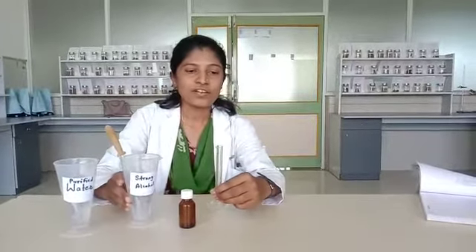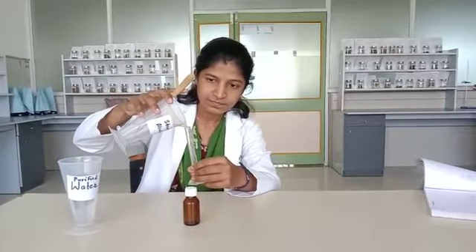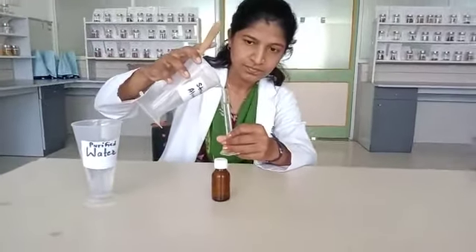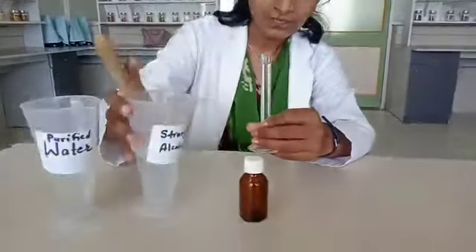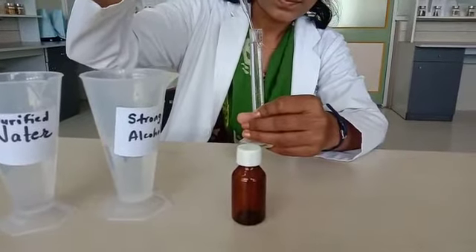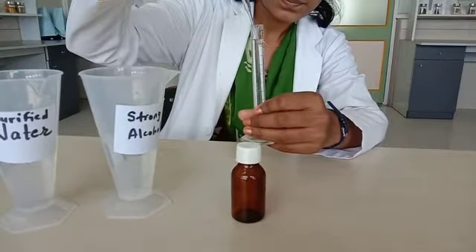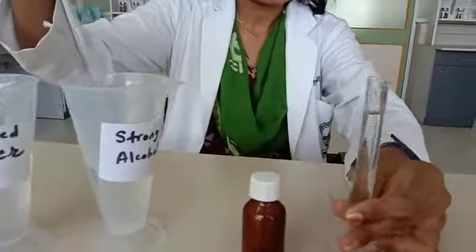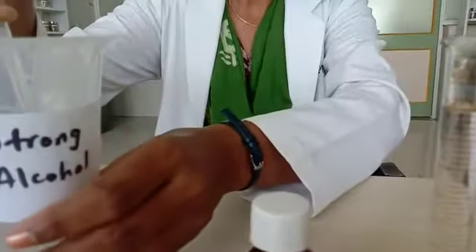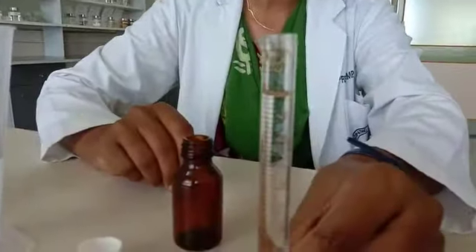First we have to take 10 parts of strong alcohol in a measuring cylinder. This is 10 ml of strong alcohol.